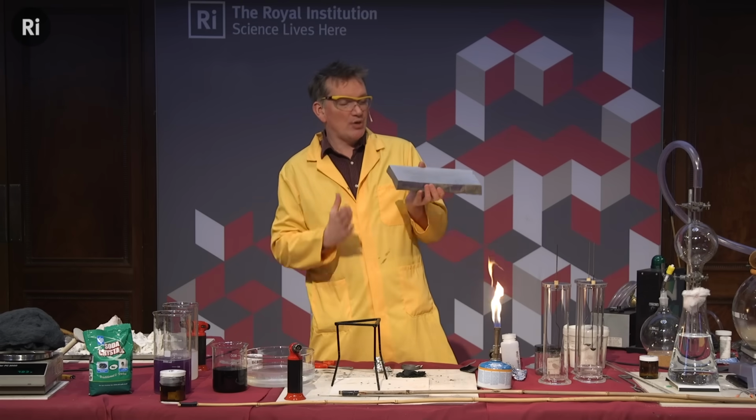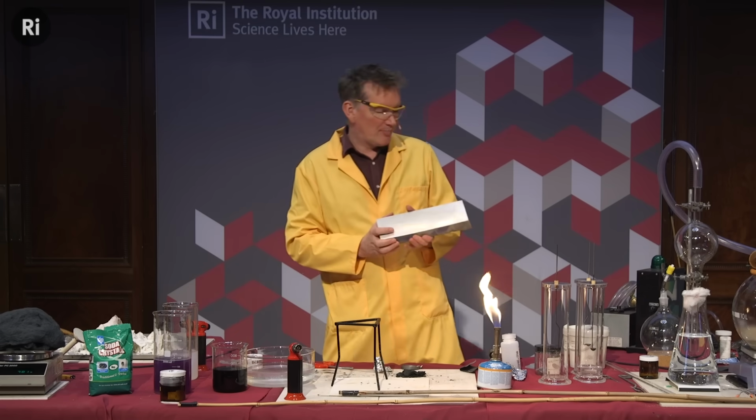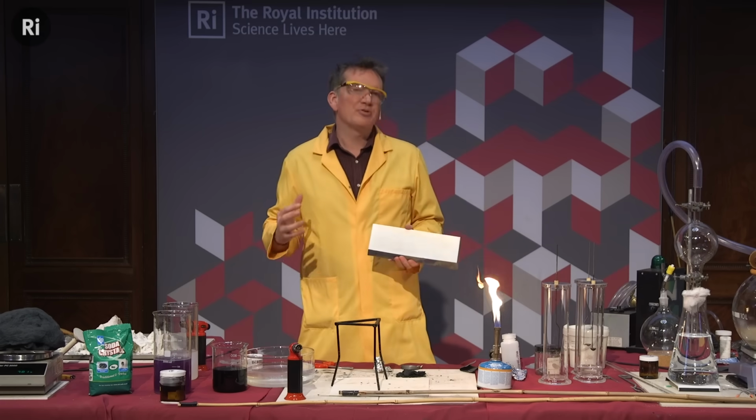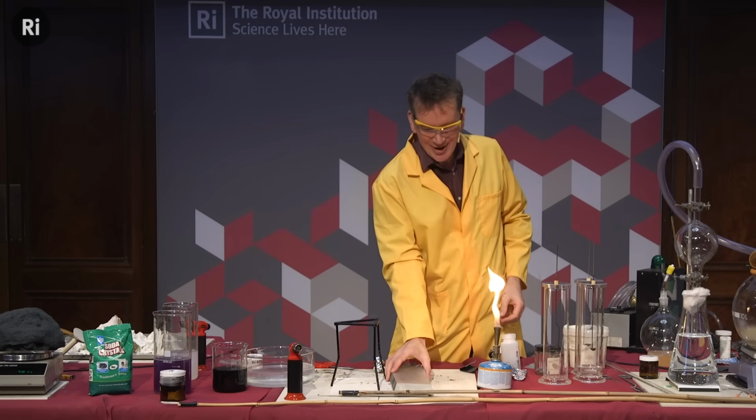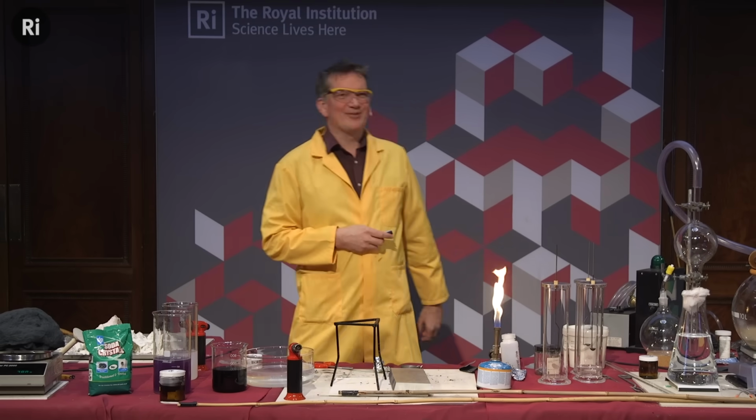In fact, this was chopped off from an even larger piece, an ingot of magnesium, that was made by pouring molten magnesium into a mold. And this would actually melt before it reacts with the oxygen from the air and bursts into flames. Okay, so yes, perfectly safe to heat that one up. Phew, but I still feel relieved nonetheless.